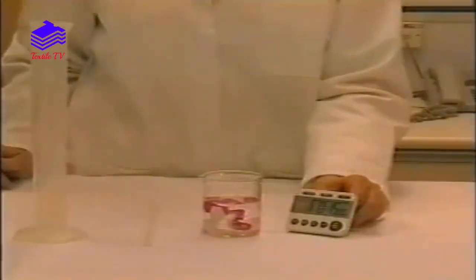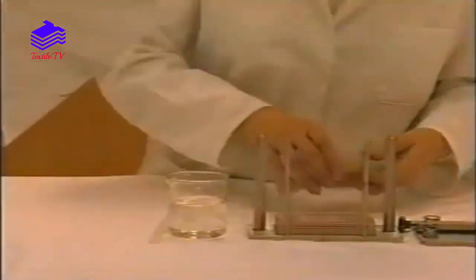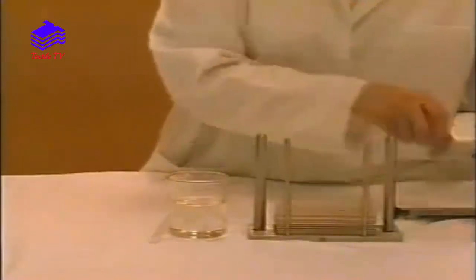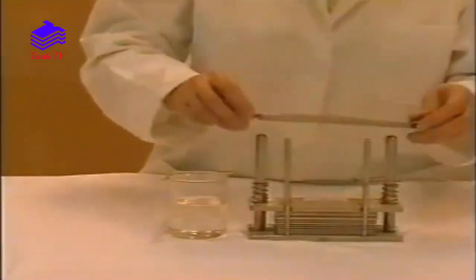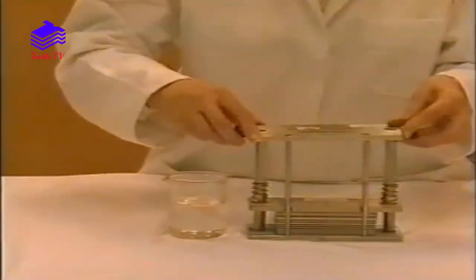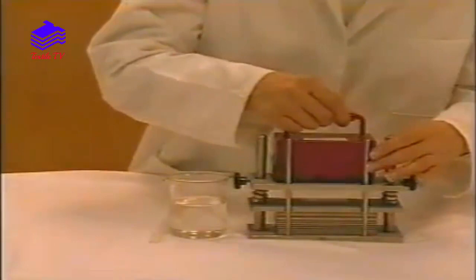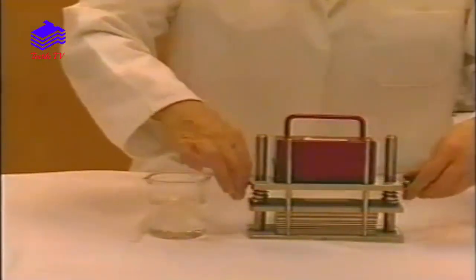After the specified time, the composite specimens are mounted between plastic plates and placed in the press. The press takes up to 20 such specimens, and when full a loading weight is applied, the top plate fixed in position, and the weight removed. Separate presses are used for the various test solutions.